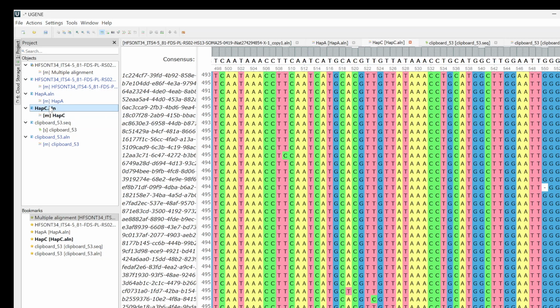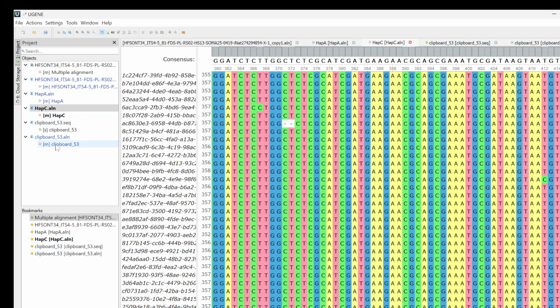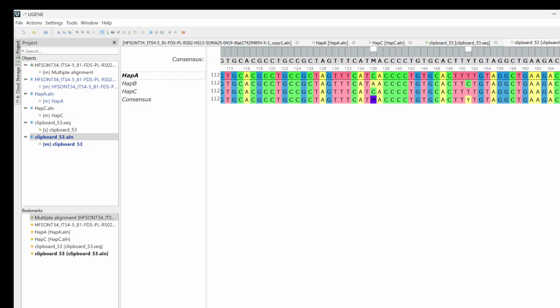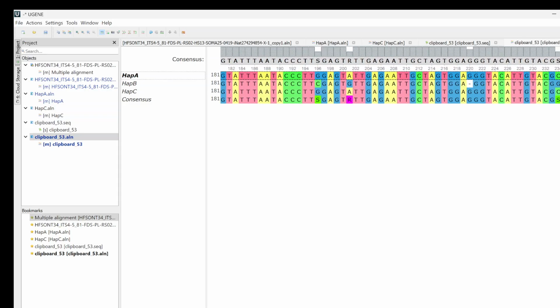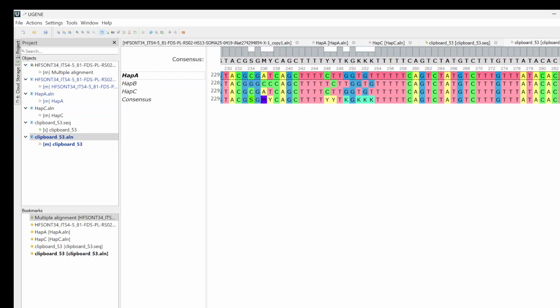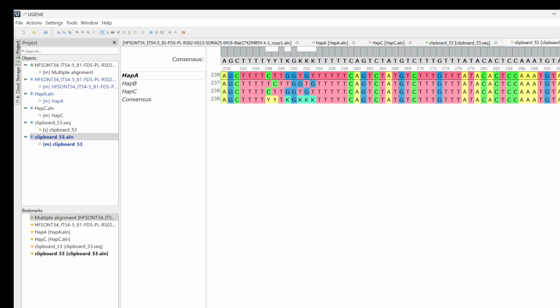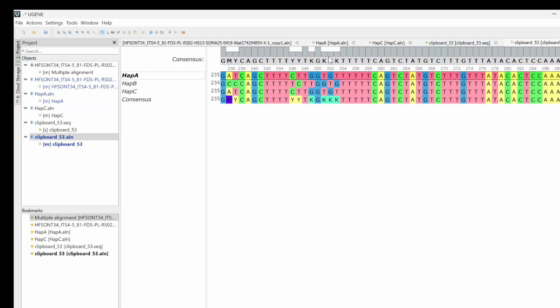Did I really need to phase out haplotype C? Debatable. How different is it from all the other ones? Well, here's haplotype C. It very much resembles haplotype A. Pretty much across the board. So it's probably not necessary. Here's something that I didn't notice before, but here's an issue. When I originally did this, I used a different program called Geneious. So what's happening here is, this consensus is actually wrong.